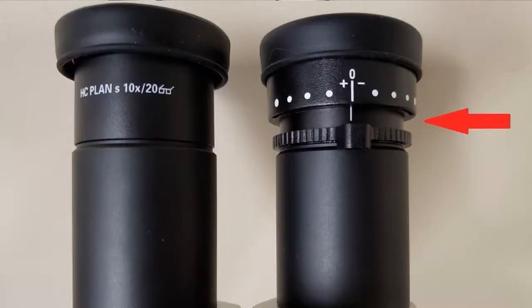First, always check the eyepieces. You should have them set to zero to begin with. If they're too high, too low, or just in between, you can have parfocality problems with your microscope.